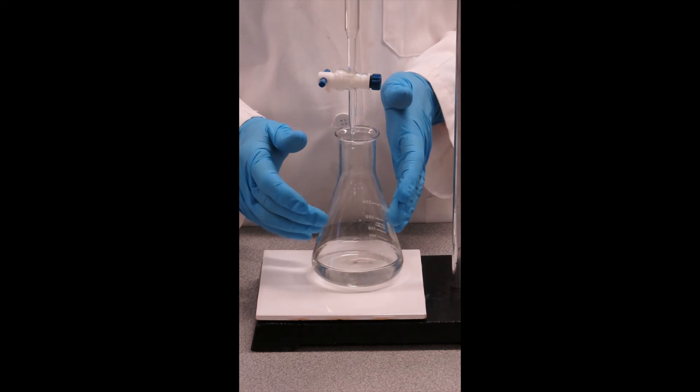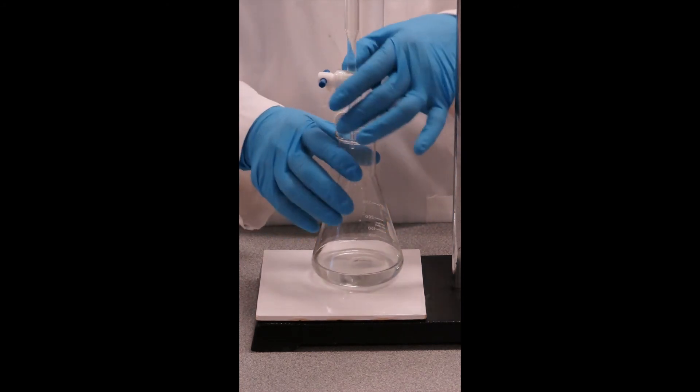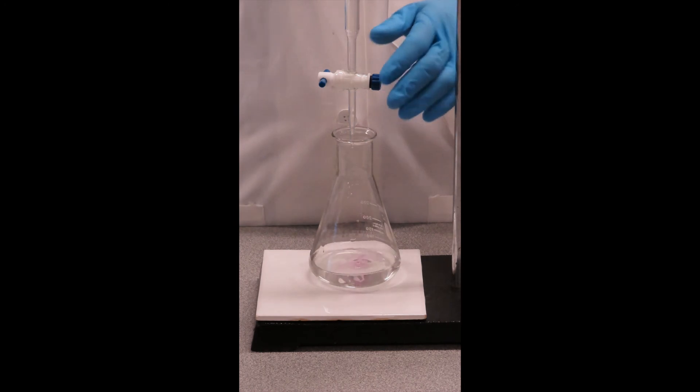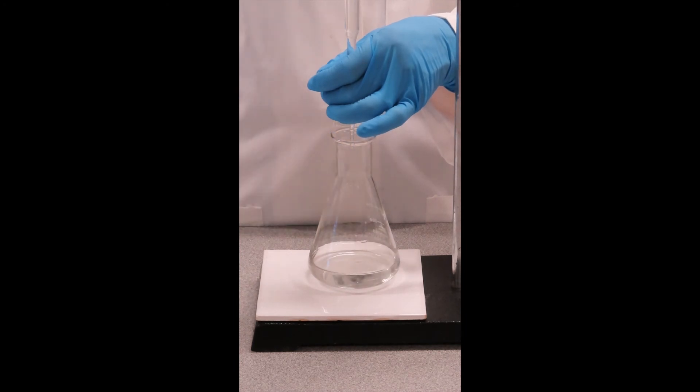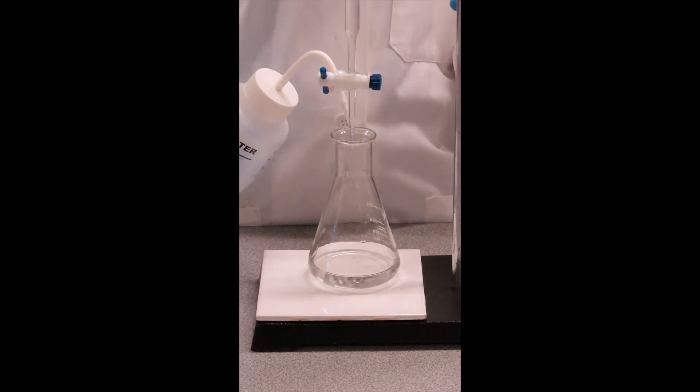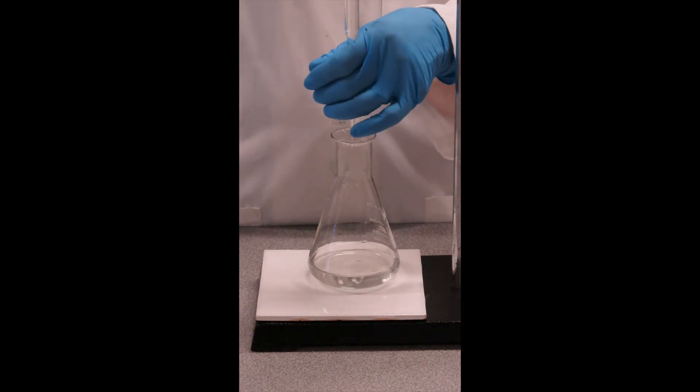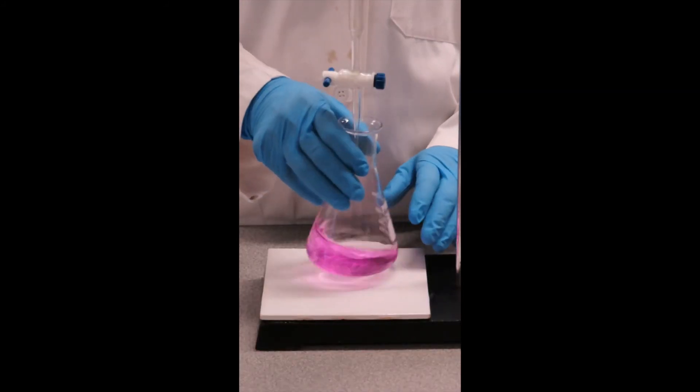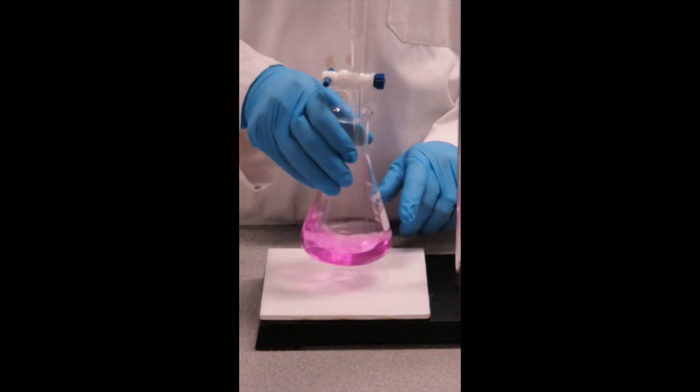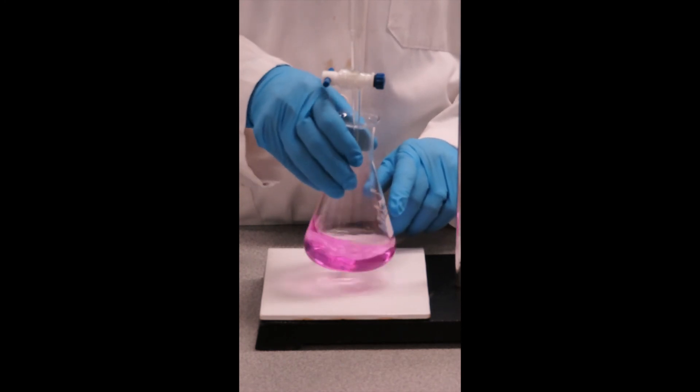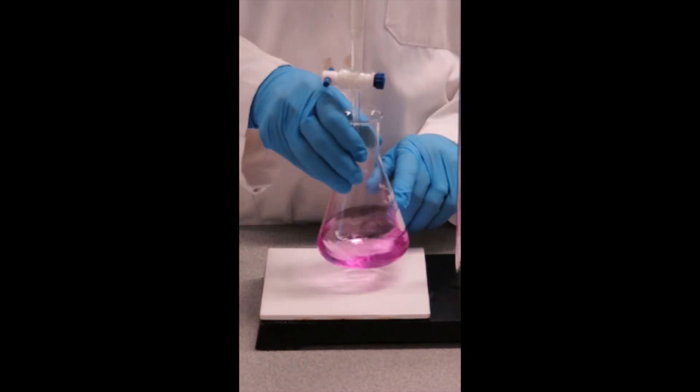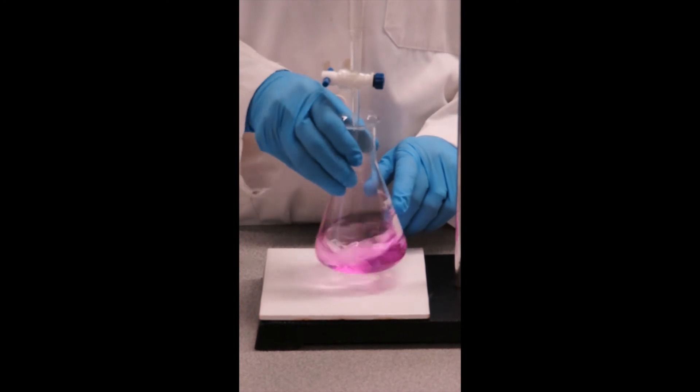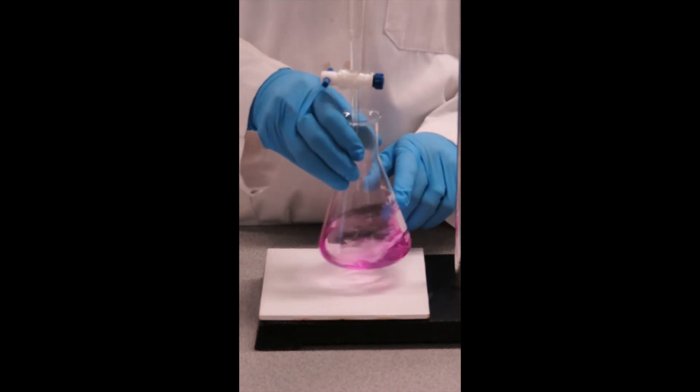Now that was very close. Now you can see that faded quite quickly. I want that pink to last for 10 seconds. So at this stage I'm trying to just get half a drop to hang on the tip of the burette. And I can then wash that in with my wash bottle. If you end up going to a color like this, that is in fact too dark. You've gone past the end point. Even as I keep on swirling, it does not fade. So I'll have to count this one as a rough one, and attempt to do a far more accurate one in a second round.